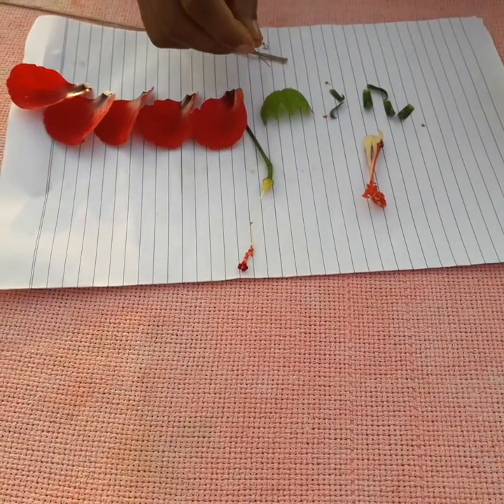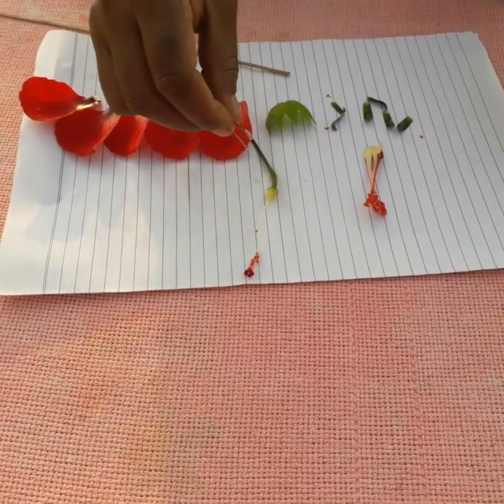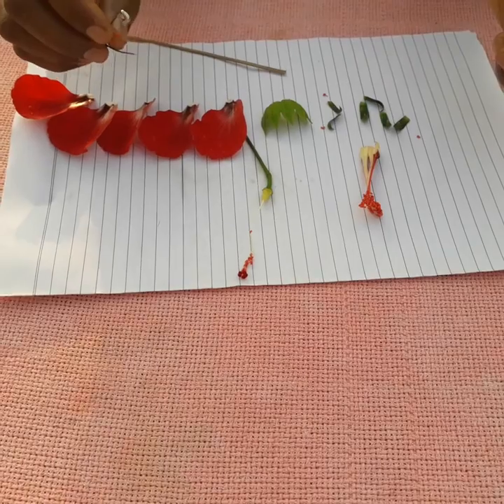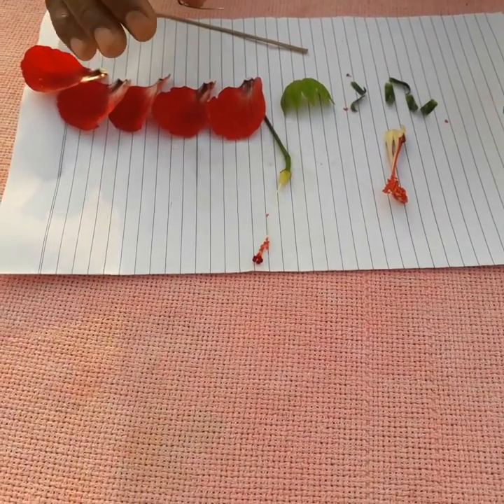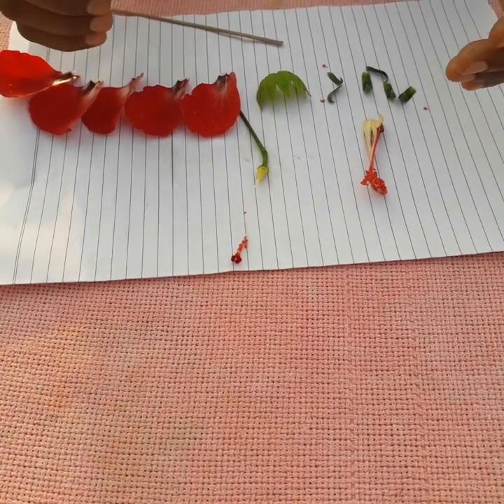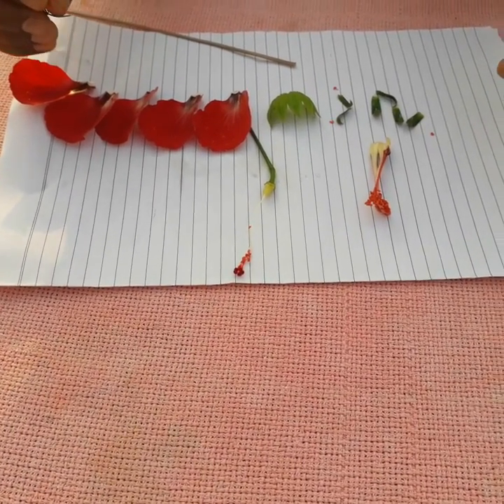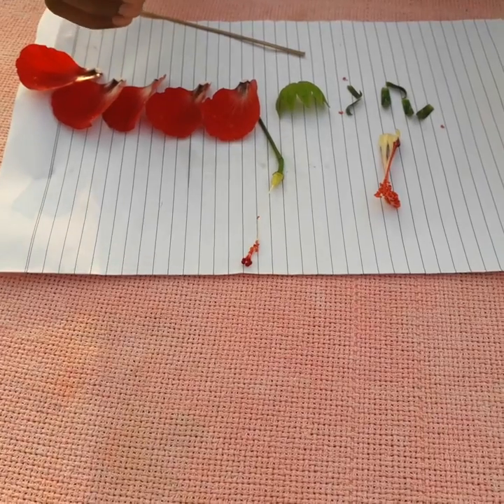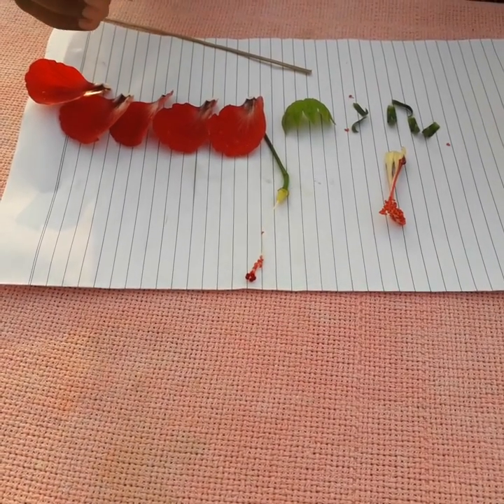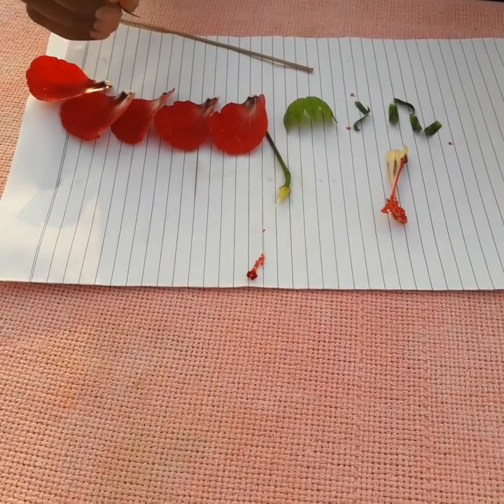Epicalyx, calyx, corolla, androecium, and gynoecium. You also take a flower and practice demonstrating or dissecting the flower and learn all the parts. Now I conclude here, but please learn — find the flower and do it at home. Thank you.